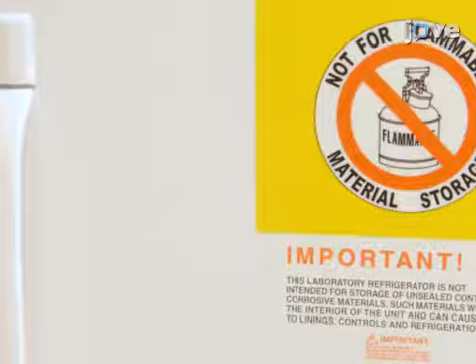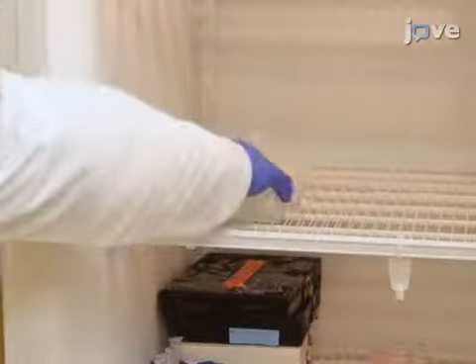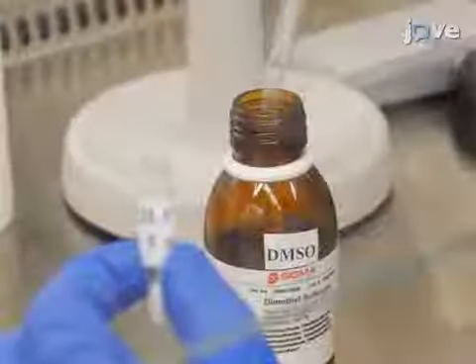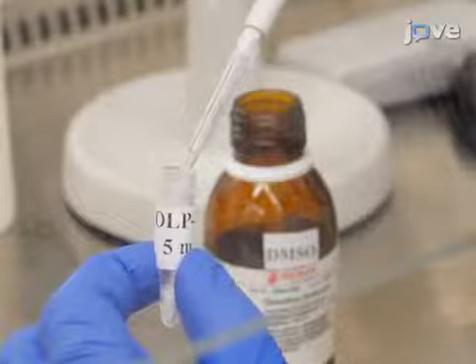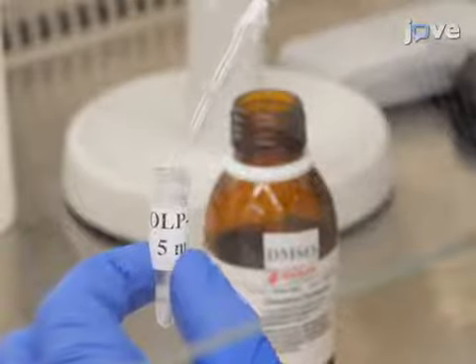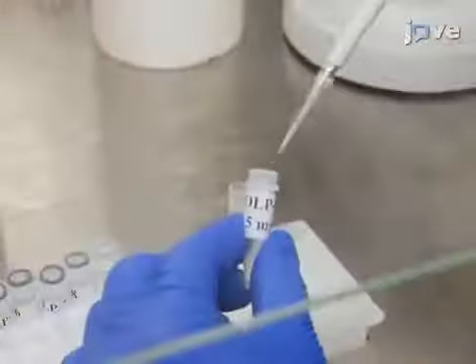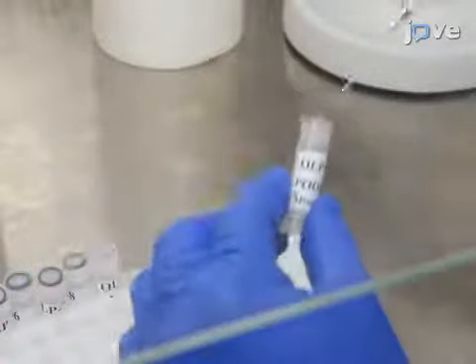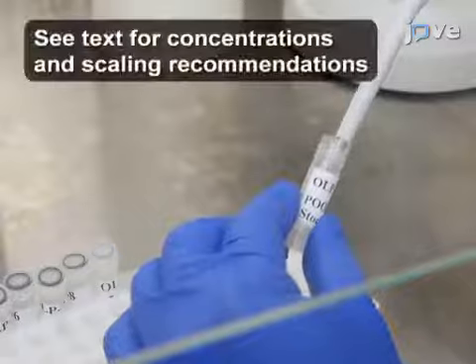To begin the procedure, design a library of 15 mer peptides in which adjacent peptides overlap by 11 amino acids. Obtain and reconstitute the peptides under sterile conditions. For each peptide, combine 5 mg of the peptide with 100 microliters of dimethyl sulfoxide. Combine 10 microliters of each peptide stock in a clean 1 ml cryotube to prepare the OLP pool stock.